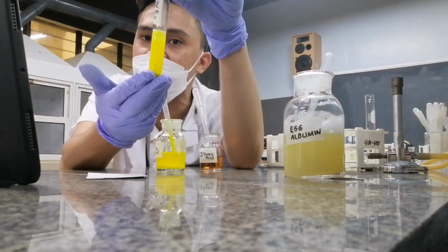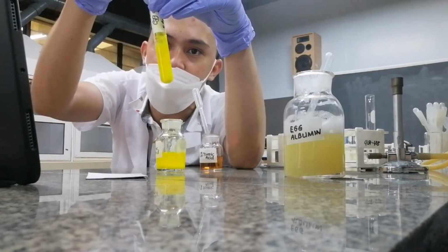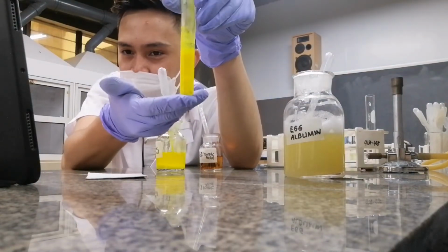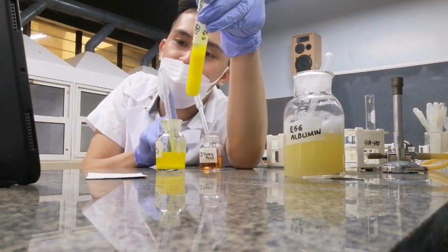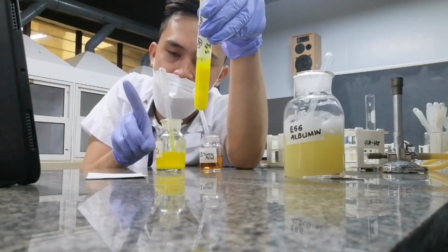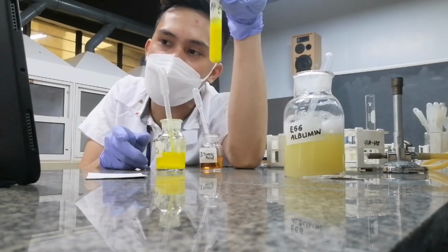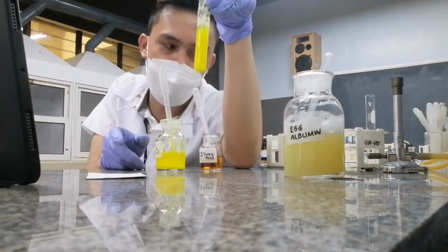But once it's alkaloidal reagent, even if I add excess of the reagent, you would notice that the precipitate will increase. Do you follow? So that's the difference between alkaloidal reagent and mineral acid. Alkaloidal reagent in excess will increase the precipitate, but mineral acid in excess will dissolve the precipitate.